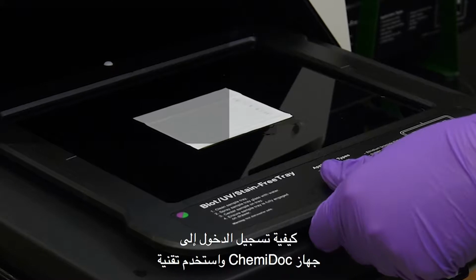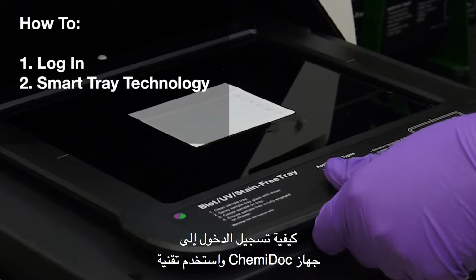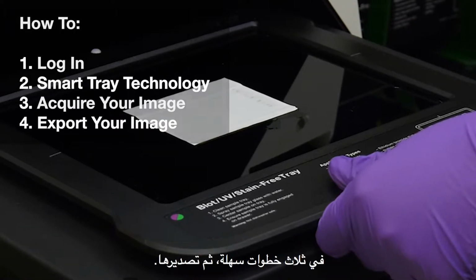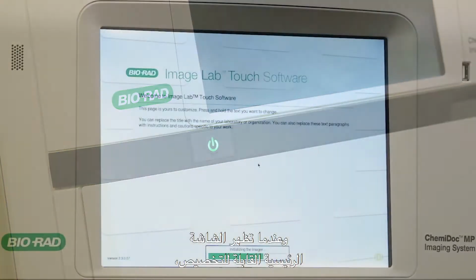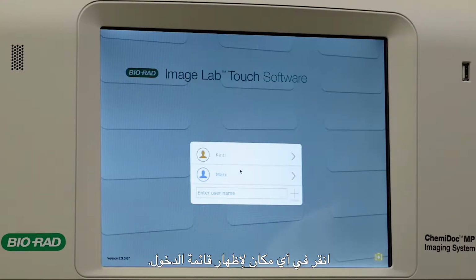In this video, you'll learn how to log into your ChemiDoc MP, use Smart Tray technology, acquire fluorescence blot images in 3 easy steps, and export them. To turn your ChemiDoc on, push the green button in front of your instrument. When the customizable home screen appears, tap anywhere to bring up the login menu.